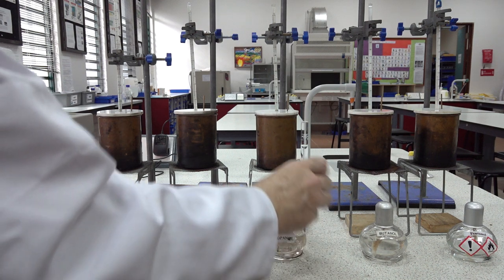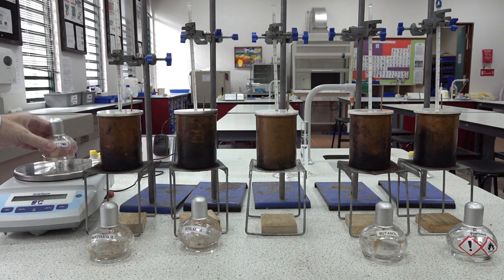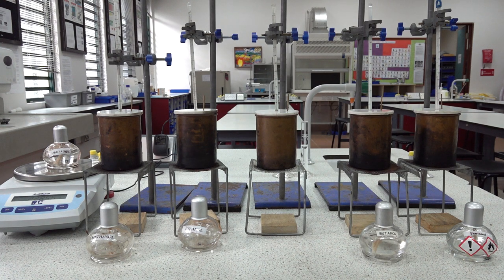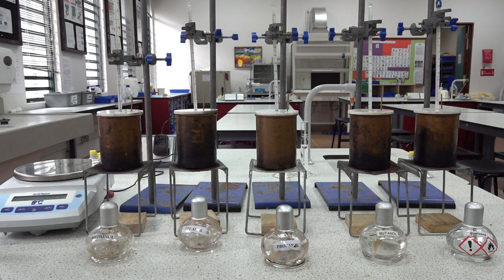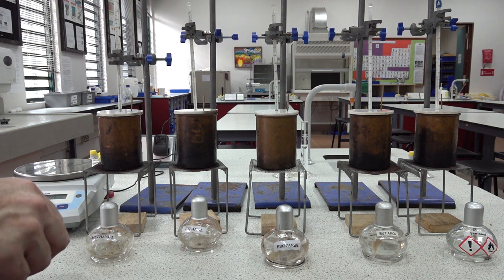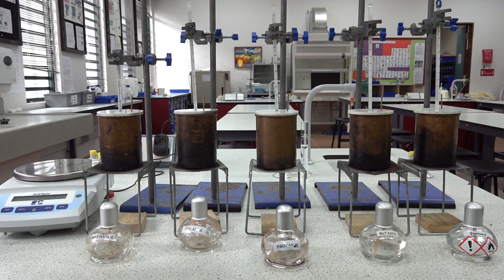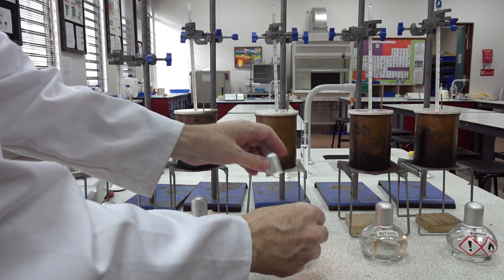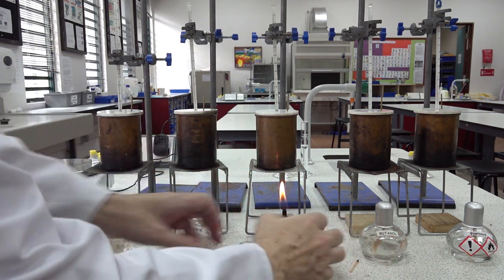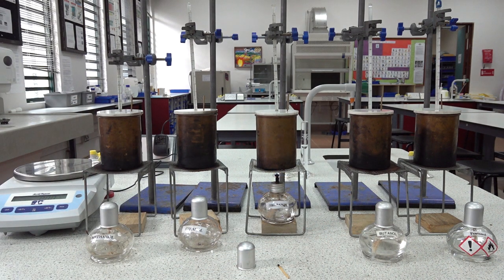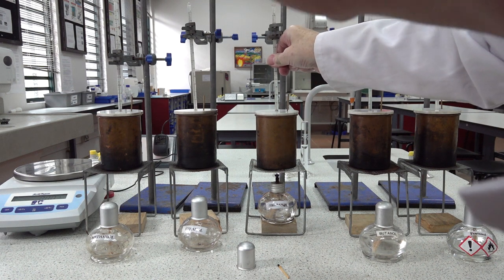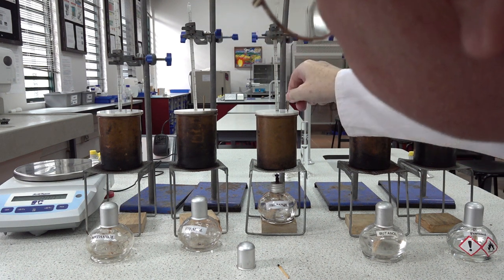The mass of the burner first: this one is 228.56 grams. Let's quickly light it, place it under, and we start heating. We need to again record the temperature at the start, which was 25 on this thermometer.